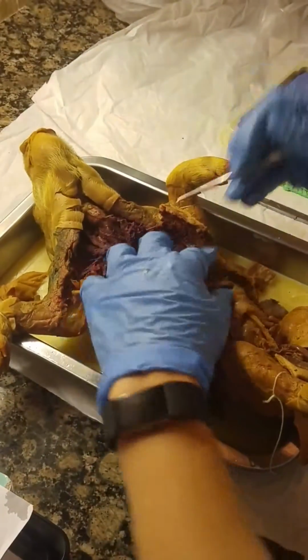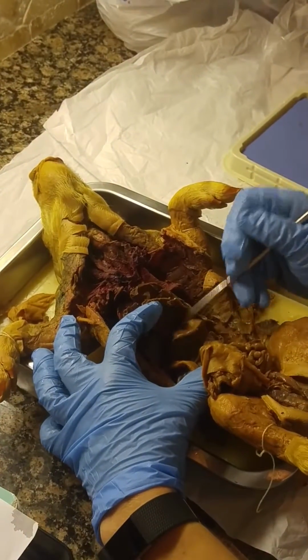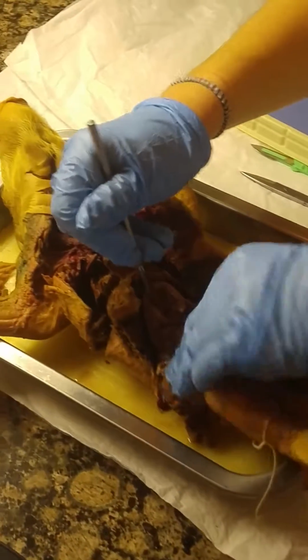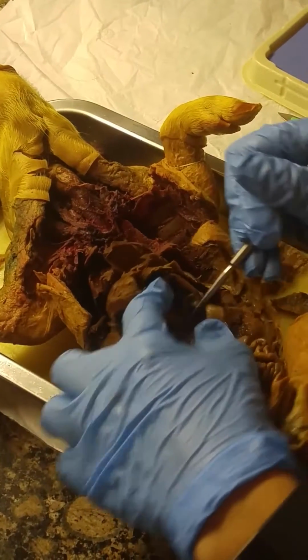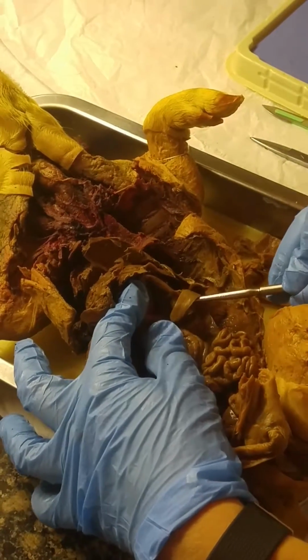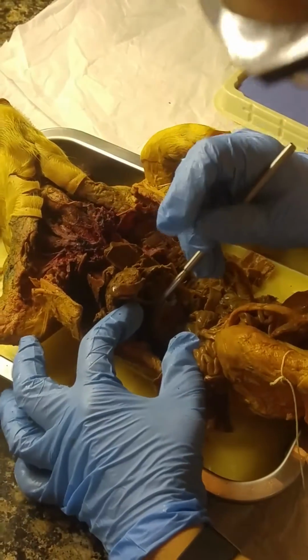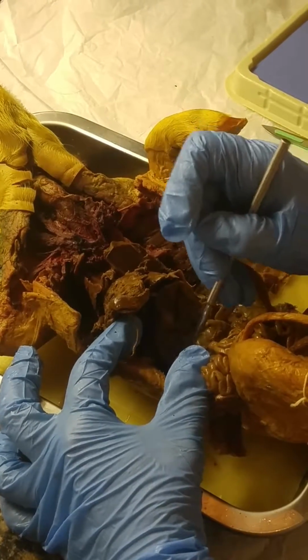And then the stomach is another empty bag-looking structure here. And the pancreas is hard to see, but it's a cottage cheese-like structure just below the stomach. This tongue-like figure here is the spleen. And then also connecting to the stomach is the duodenum, which is the beginning of the small intestines.